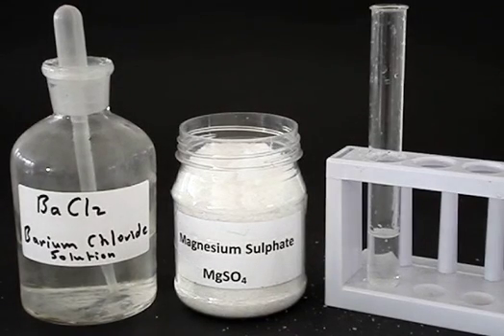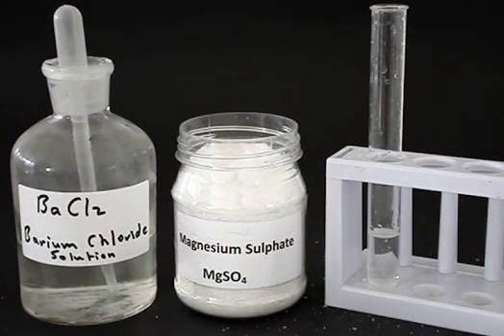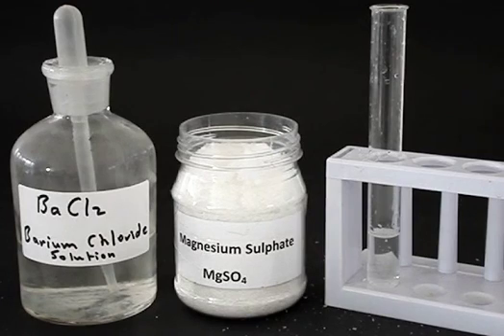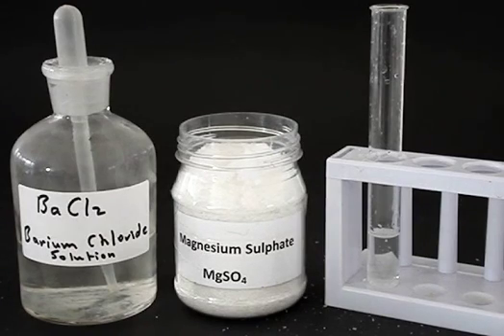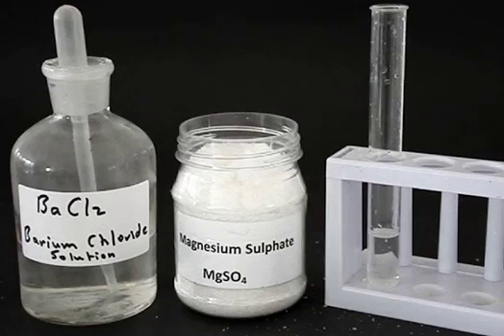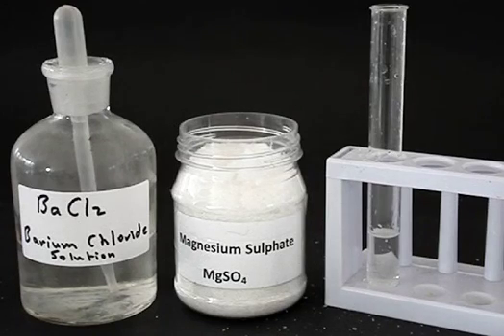If we take a look at that, we can't really tell what it is because it just looks clear — we could even think it might be pure water. And so we need some kind of test to show up what the substance is.